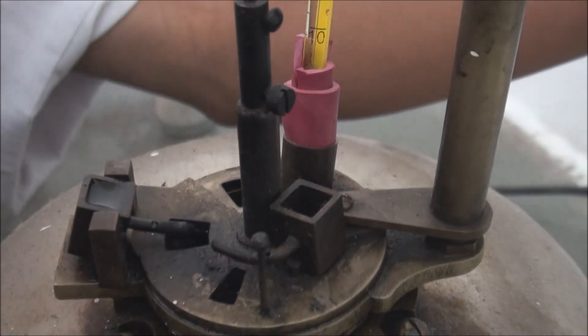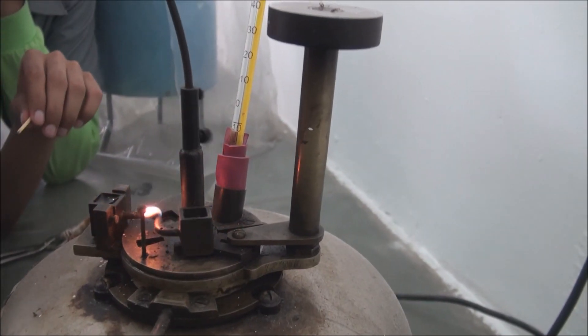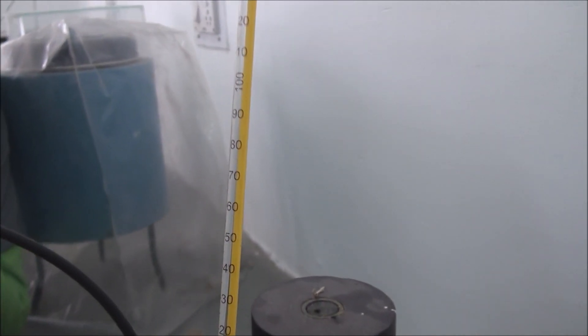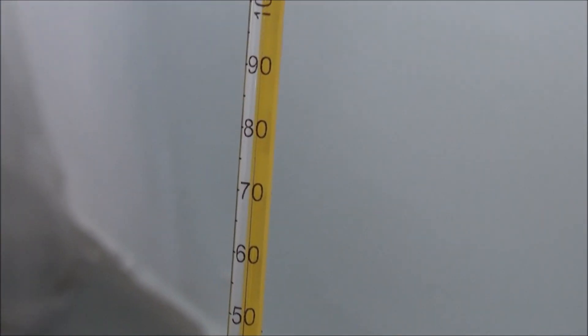You can notice the flash point achieved in this temperature range. When the flash point is achieved, the lubricant gives out a flash as shown previously. After the flash point is achieved, you will keep noticing flashes when you open the lid.